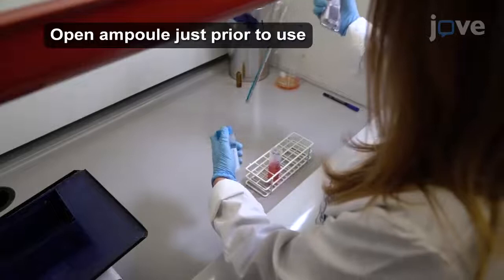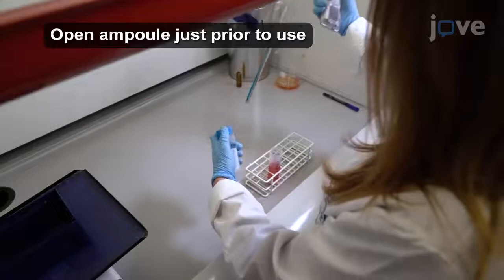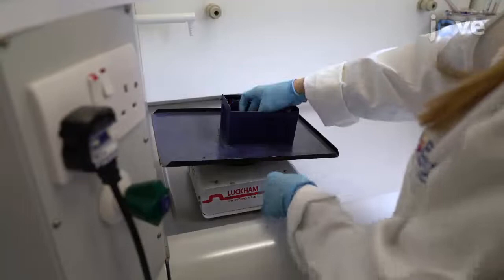Then, add 4.375 milliliters of 16% methanol-free paraformaldehyde to a final concentration of 2%. Fix the cells for 10 minutes at room temperature with gentle mixing on a rocker.